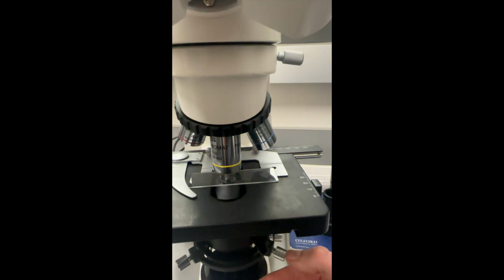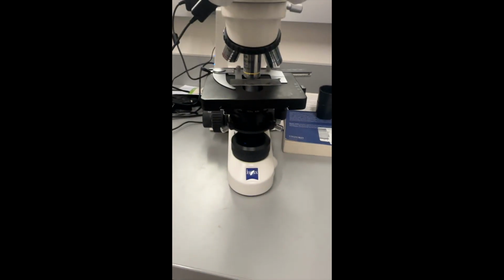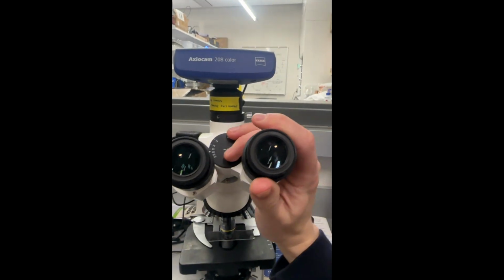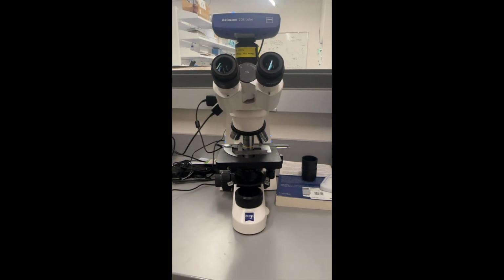And what I'm doing right now, you can't see it, but I'm moving the aperture lever to the right. And basically, the circle at the bottom is going to get smaller and smaller until we start to see the polygon edges of it right there. And basically, we want that little light polygon to take up 2/3 of that bottom hole. So we're going to get like, yeah, that's about perfect right there. And yeah, that's pretty much it. Once we have it at that 2/3, we leave the aperture lever at wherever we have it. We put the eyepiece back in. And we are now ready to examine our otolith specimens.